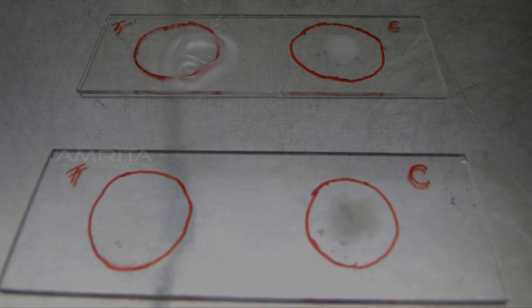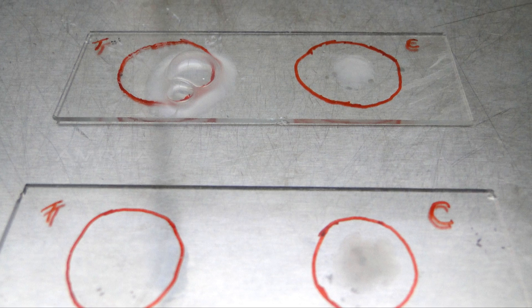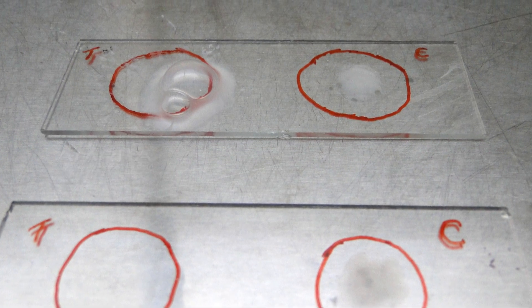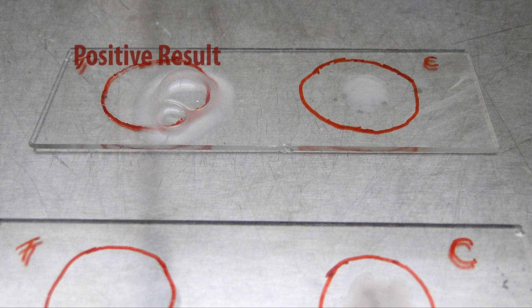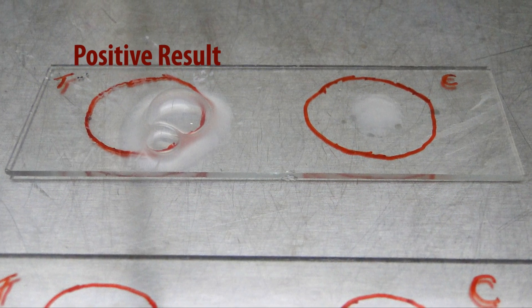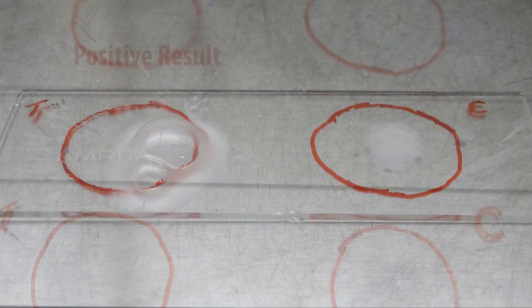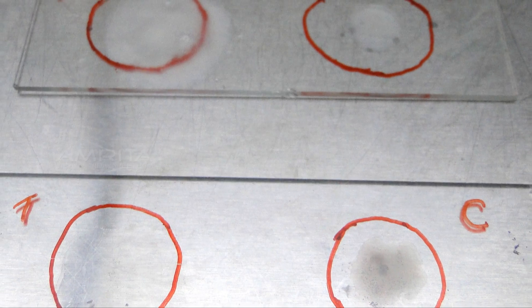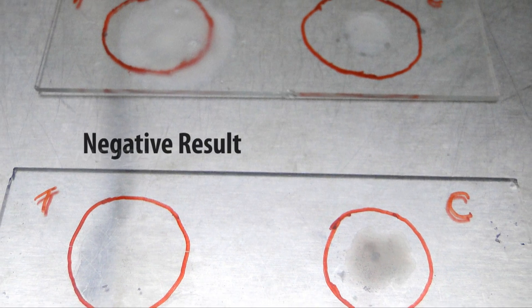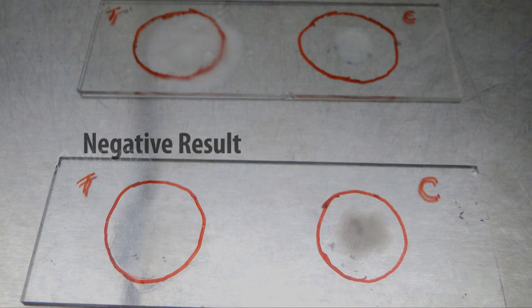Result. After addition of hydrogen peroxide on the marked field, if the organism is catalase positive, bubbles will form on the glass slide — this is a positive result. For catalase negative organisms, there will not be any bubble formation.